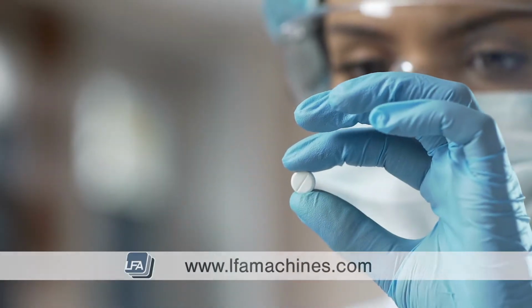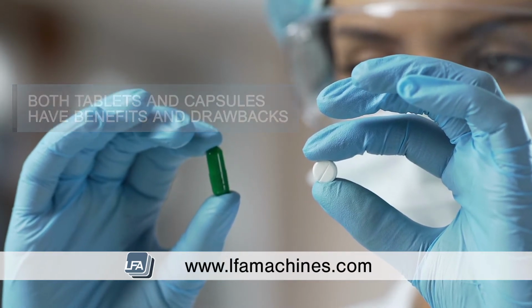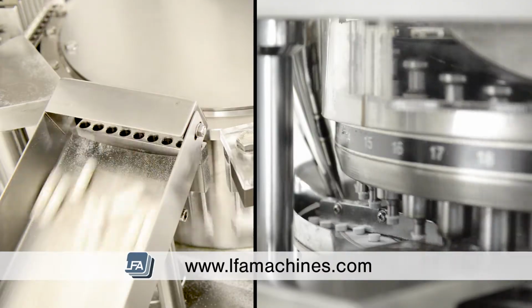Welcome to LFA's video on the difference between capsules and tablets and the machines that can produce them. As we're one of the world's leading suppliers of both machines, we are well placed to answer this question. Both have benefits and drawbacks, so today we're going to talk about those.